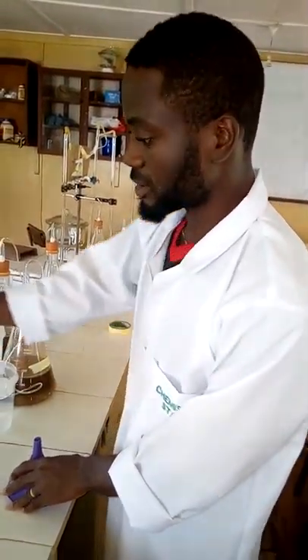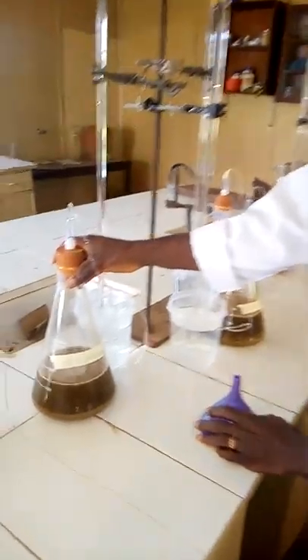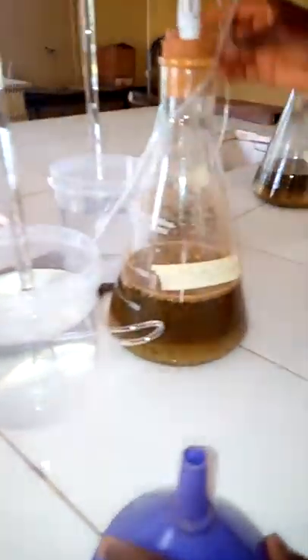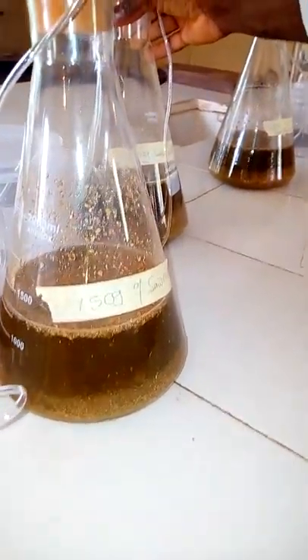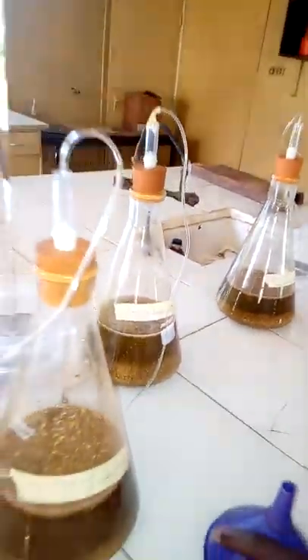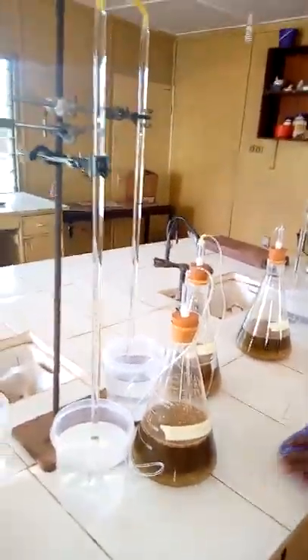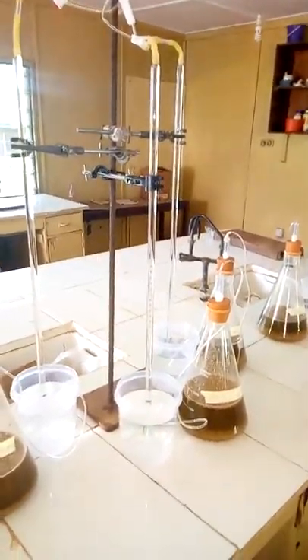In the second stand, the sawdust mass varies: the first conical flask has 100 grams, the second has 150 grams, and the third has 200 grams. Again, the quantity of rumen fluid remains constant at 100 ml across all nine conical flasks.